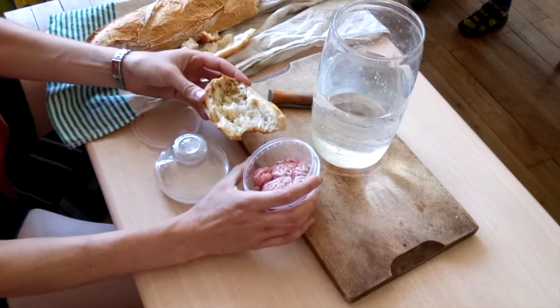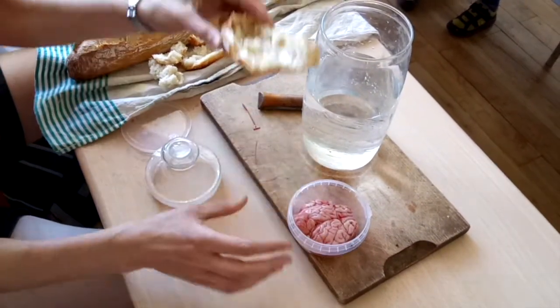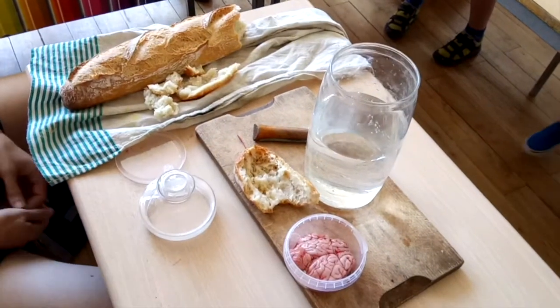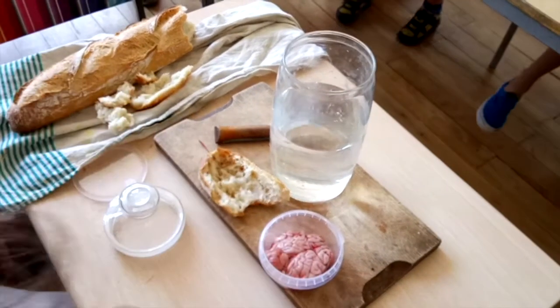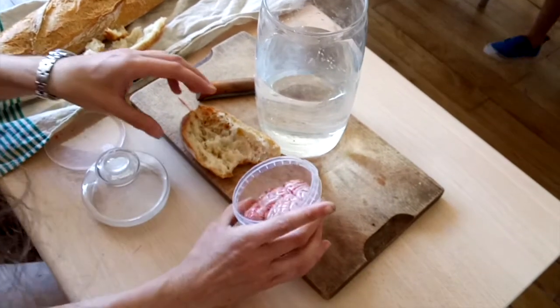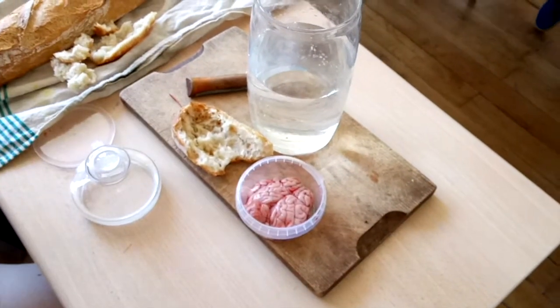You can do it on the water, and then we will push it a little. And we will try to put it on the water. You don't touch that. And you make it a little glisser.